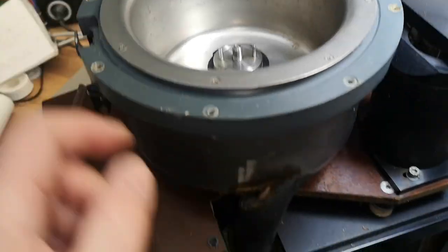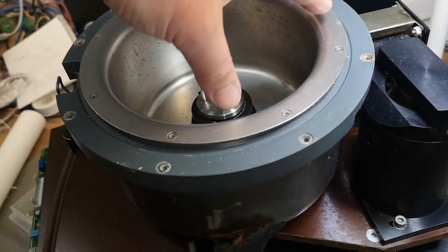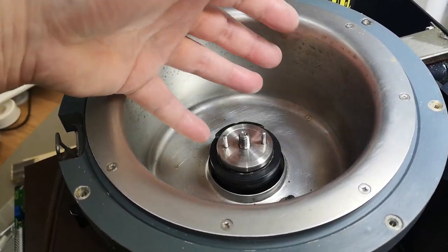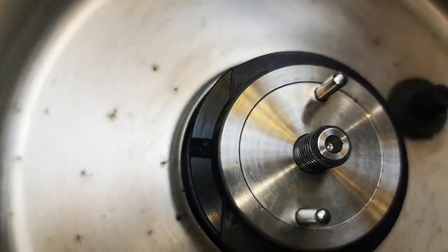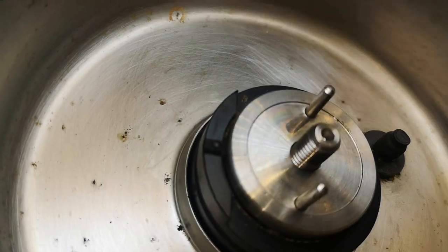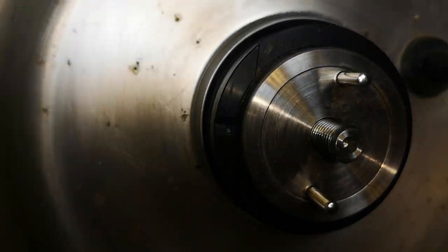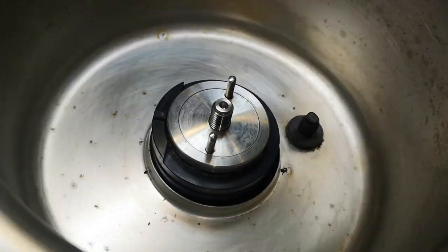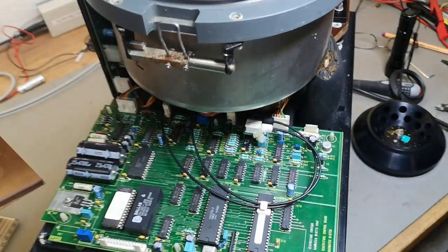This is the cooling system — the compressor output goes up here and is wound around as a cooling coil so this entire area can be nice and cold. There's a temperature sensor here. There are two optical sensors in little holes shining at a 45-degree angle to the different color codes on the back of the rotor — this is what identifies the rotor type.